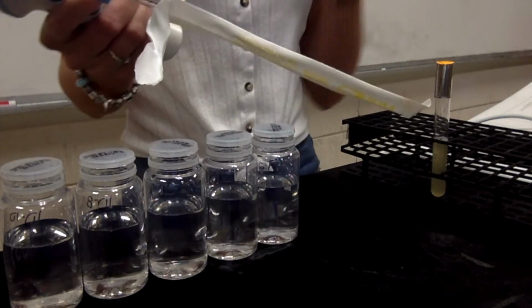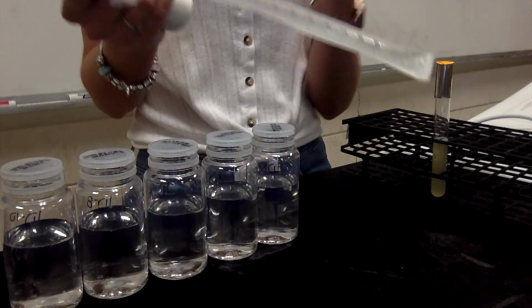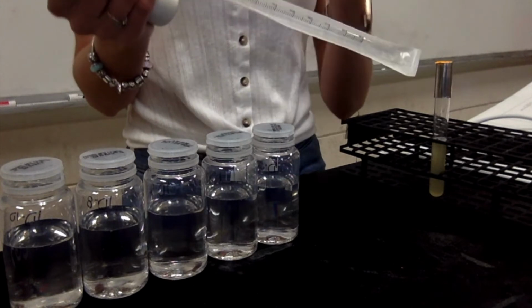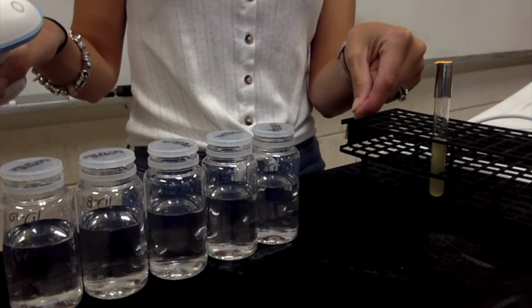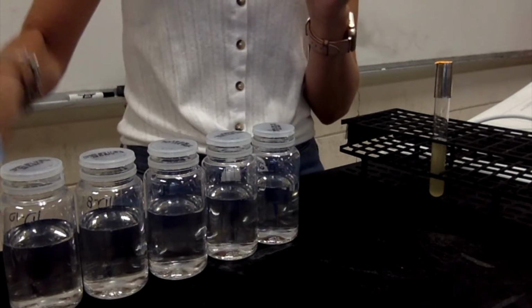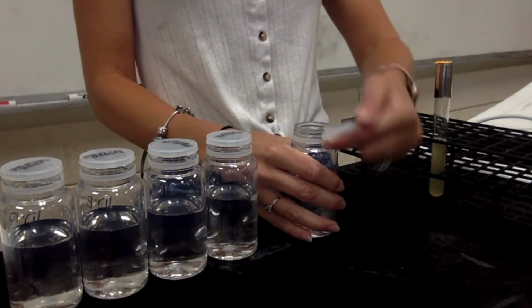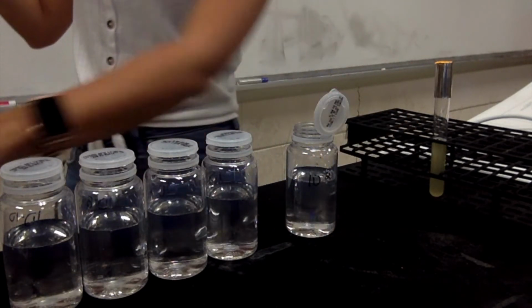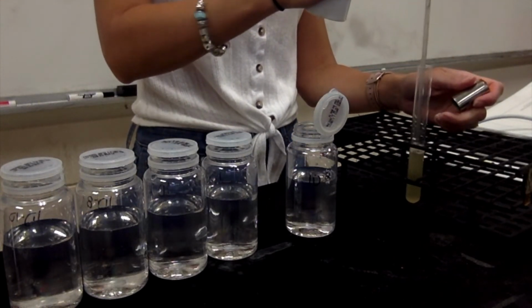What I always like to do is I always keep the paper on the pipette until I'm ready to actually pipette over. This helps prevent contamination, because if I want to lay this down to open up my dilution blank, I can do that. So I'll leave my paper on. I'm going to open my dilution blank, and I'm going to go ahead and pipette 1 ml into my dilution blank.